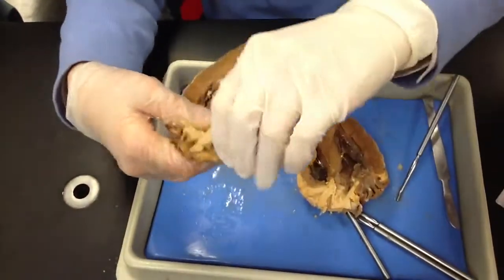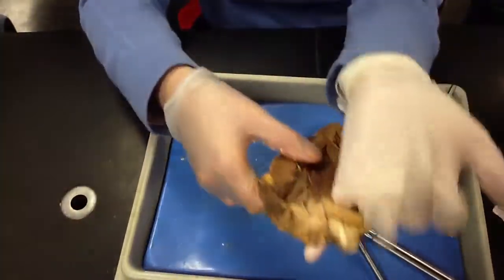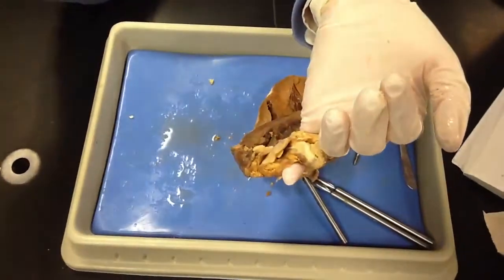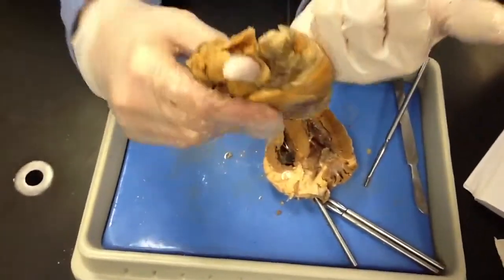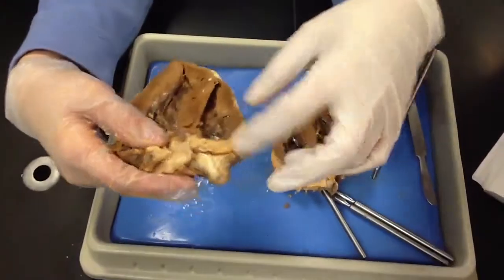Okay. So this is going to be your right atrium. So, what blood vessel is going to correspond with the right atrium? So it's going to go from the tissues to what? Superior vena cava. Vena cava. Good. So it's going to flow into what? The right atrium. Okay.